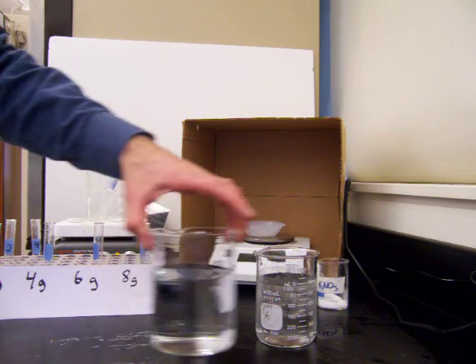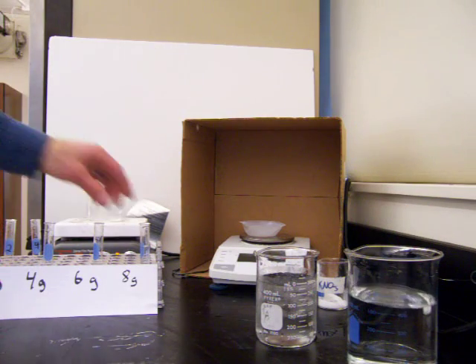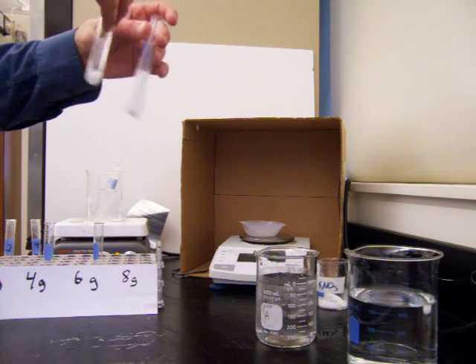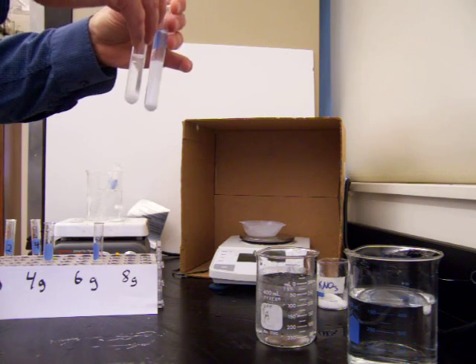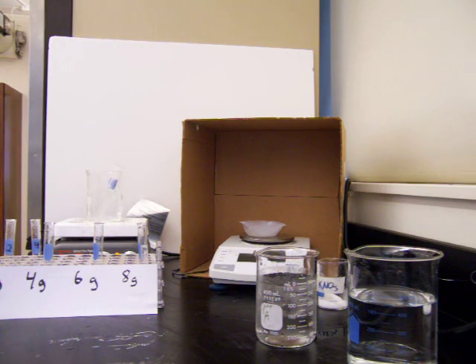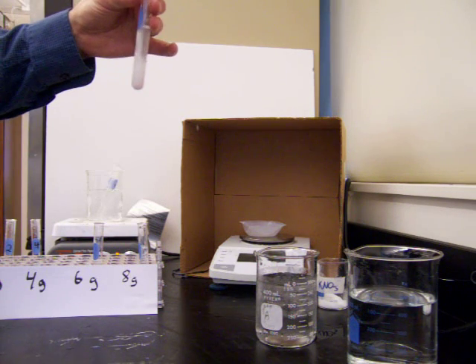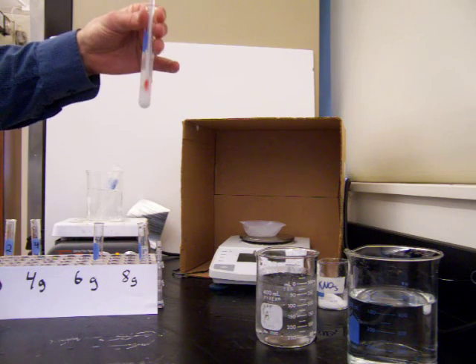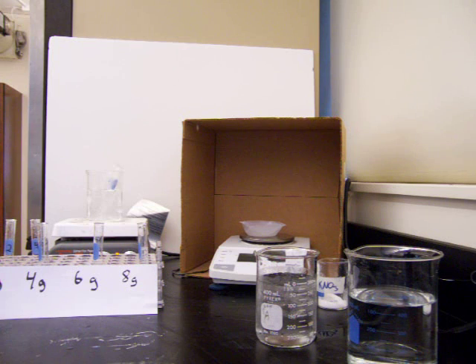We made up our 4 solutions with low concentration on up to a high concentration. If you look at the solutions right now, we can mix them around a little bit and they don't dissolve all entirely right away. In order to make things dissolve faster, there's a couple things we can do. One thing we can do is stir it. That brings the solute particles in contact with the solvent more frequently and makes them dissolve faster. We can also change the surface area by making the particles smaller, or we can use heat. When we heat things, generally at higher temperatures they'll dissolve more quickly.